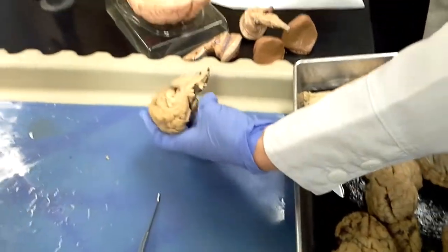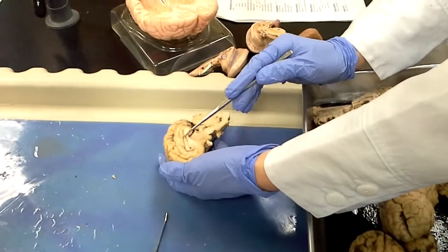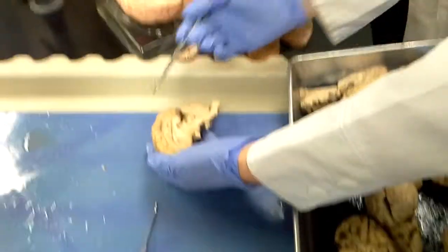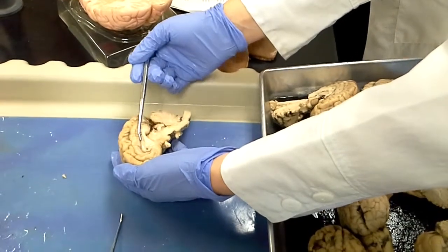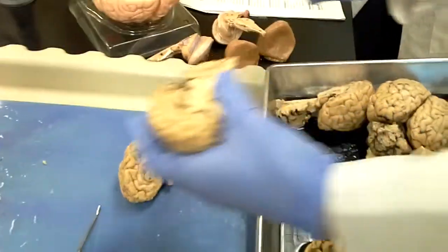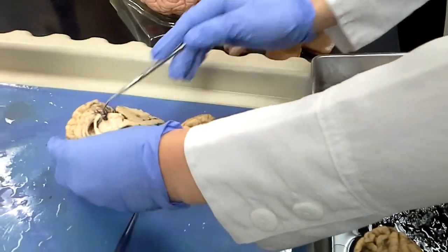Corpus callosum, you're going to see from a sagittal view, it's that thick, white, tough band of tissue here. Just when you get through that longitudinal fissure, that's where the right and left hemispheres would be connected. So in different cuts, you might see it a little bit better. So it's that top ridge of white tissue.